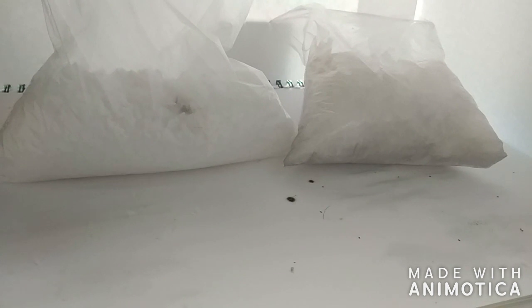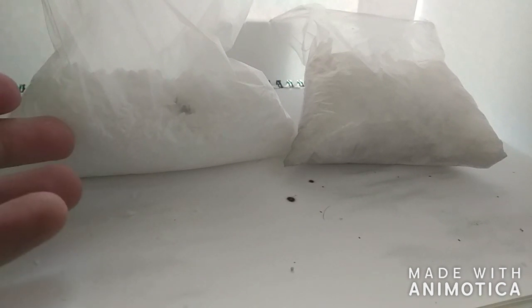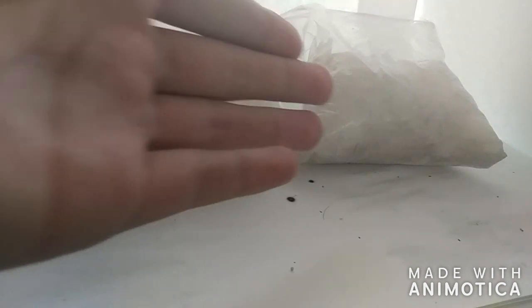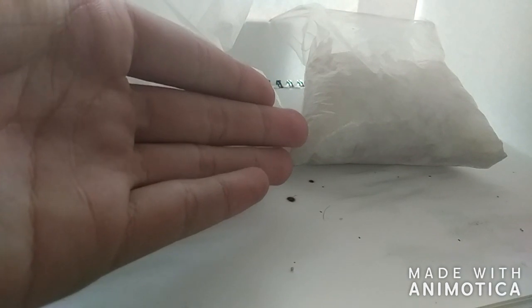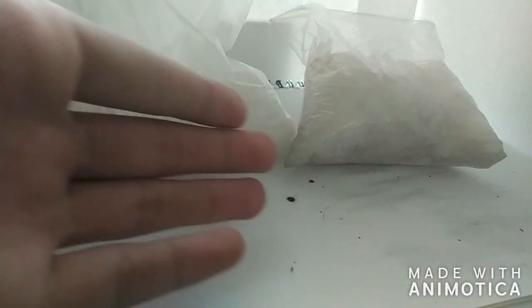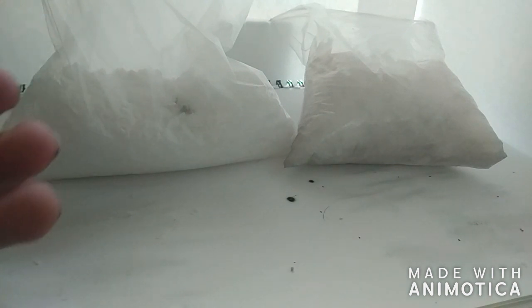Now, if we plug these numbers, we can actually see that I've got about a 50% yield of potassium chloride, and 139 percent of sodium chloride with potassium chloride.